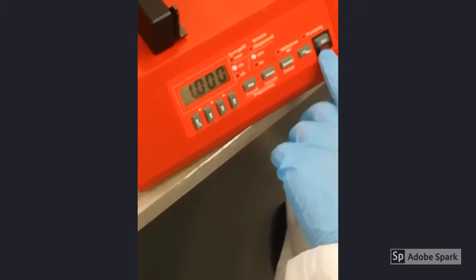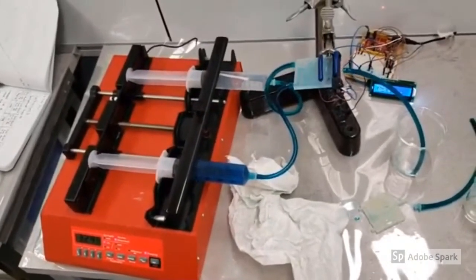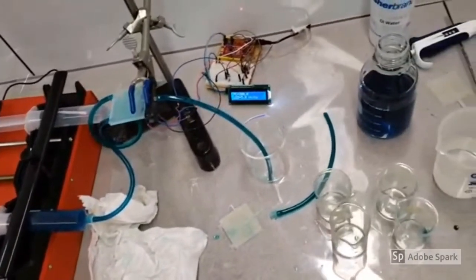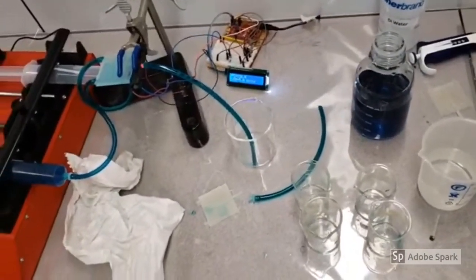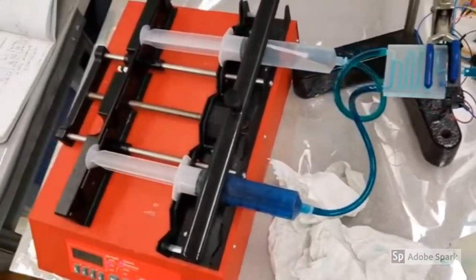through each reactor with multiple flow rates, that being 1, 2, and 5 milliliters per minute. Each flow rate was run through twice in each reactor. These flow rates entered through one inlet stream, with sodium hydroxide being the other. When both streams enter the reactor, a reaction was formed.